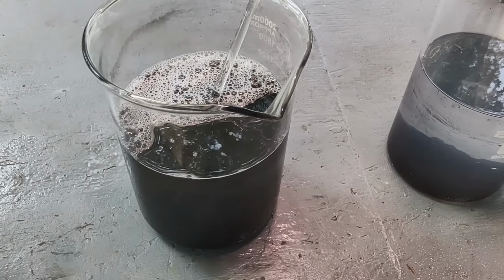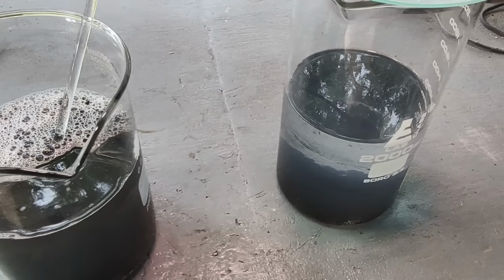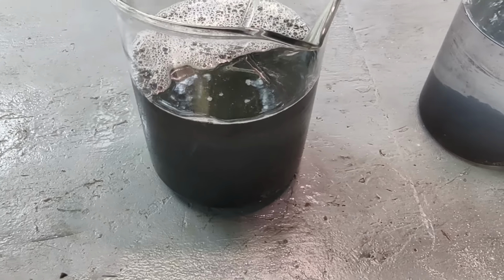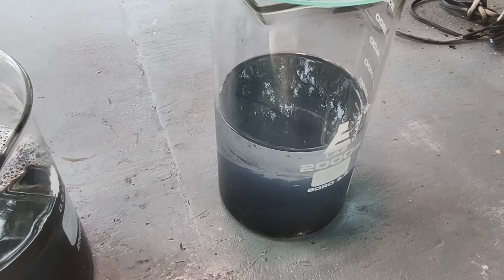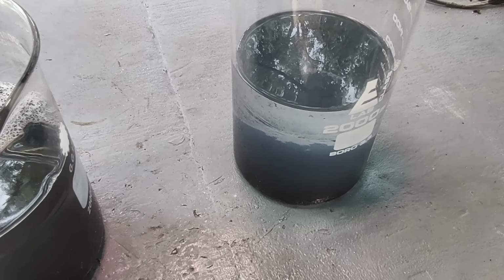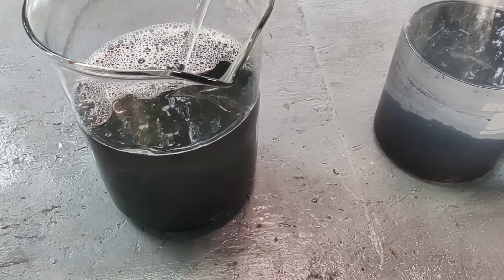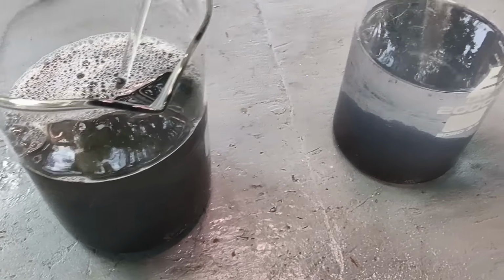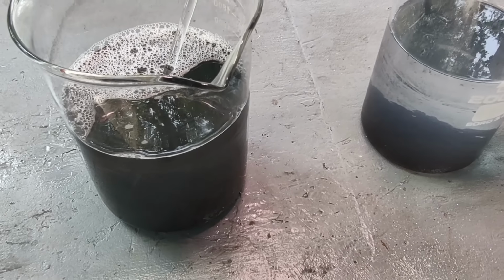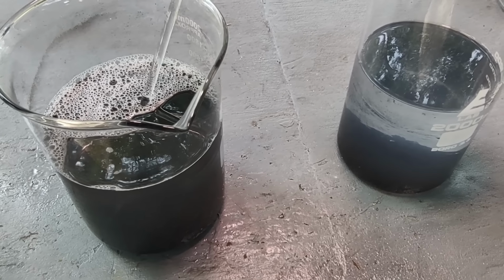Alright, so what's my next plan? Well, I'm going to decant off the liquid in these beakers. I'm going to give this one a chance to settle a little more because I've got it all stirred up now. Decant off the liquid in these beakers through a filter in a funnel, just so I can capture any fine palladium that comes over. And that'll go in my filter and rag storage so I won't lose it. I'm going to combine all of the palladium into one beaker, and we're going to give it some distilled water boils, clean it up. Then we can dry it out and weigh it and see how much we've got here.